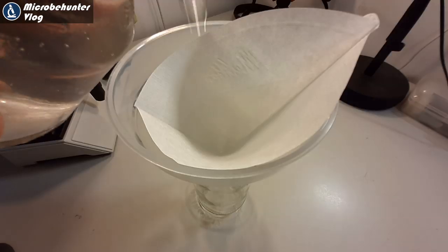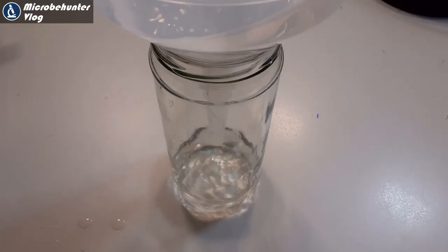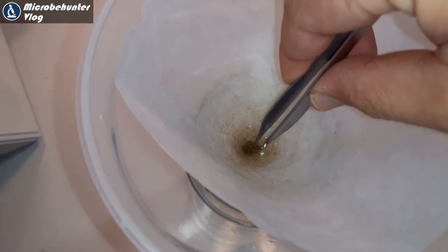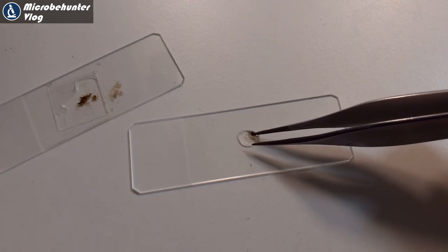I'm a little bit concerned that the concentration of water microorganisms might be low. So I'm going to try something new today — I'm going to use a coffee filter to concentrate the water sample a little bit. One of the problems when looking at water samples under the microscope is that there are not so many organisms directly in the free water. You have to look at the residue — the solid material — because many microorganisms are attached to solid decaying plant material.